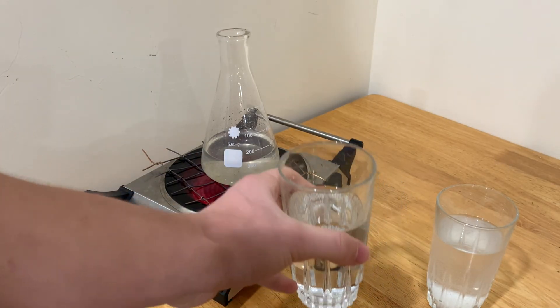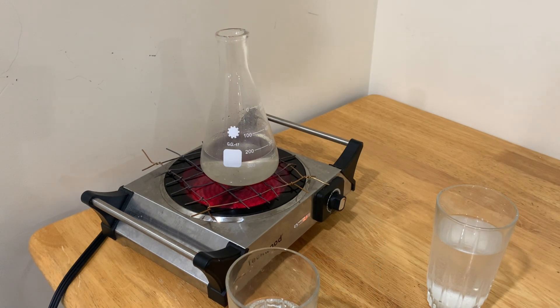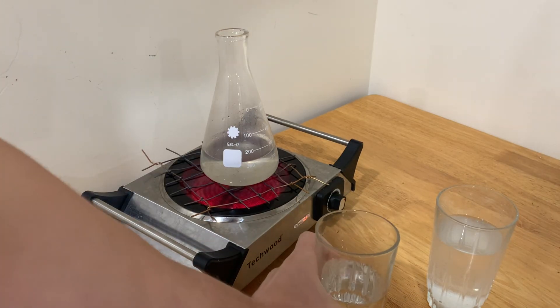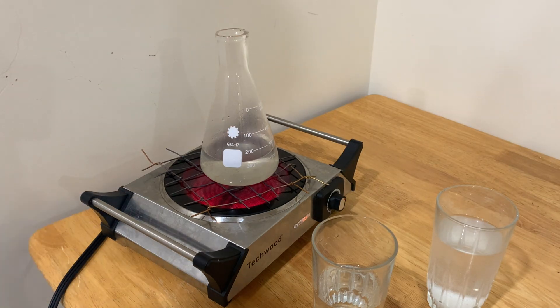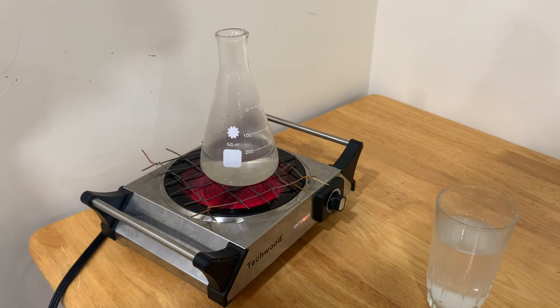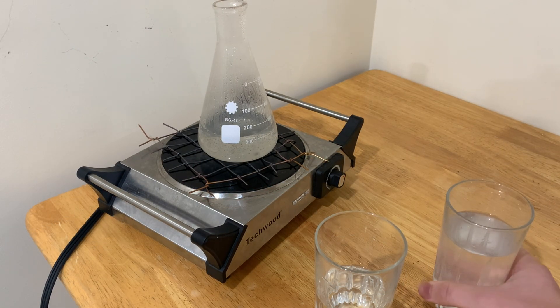This cup here I've actually washed and poured some water into, because I get thirsty during the making of these videos. Sulfuric acid itself is actually a liquid at room temperature — by sulfuric acid I mean dihydrogen sulfate. So what this means is that we will boil all of the water here, and only water will come out during the heating. The magnesium sulfate is going to stay right here, and so will the sulfuric acid. The sulfuric acid concentration will just go up, the magnesium sulfate will precipitate, and we're basically using that property to keep all the sulfuric acid dissolved and only boil the water away.